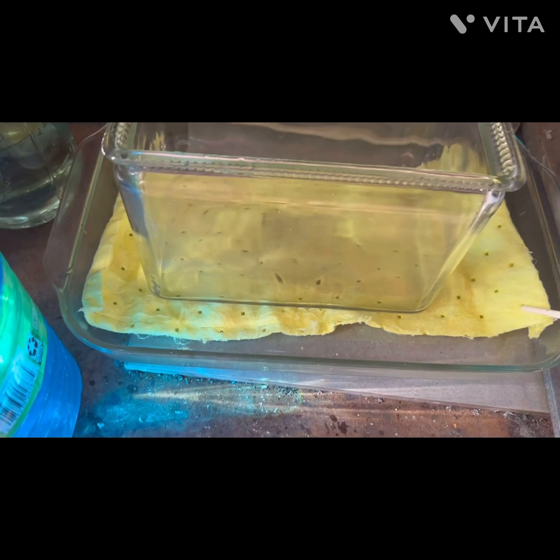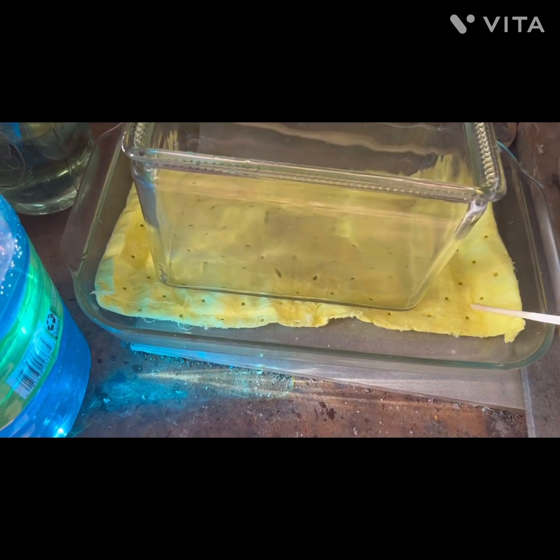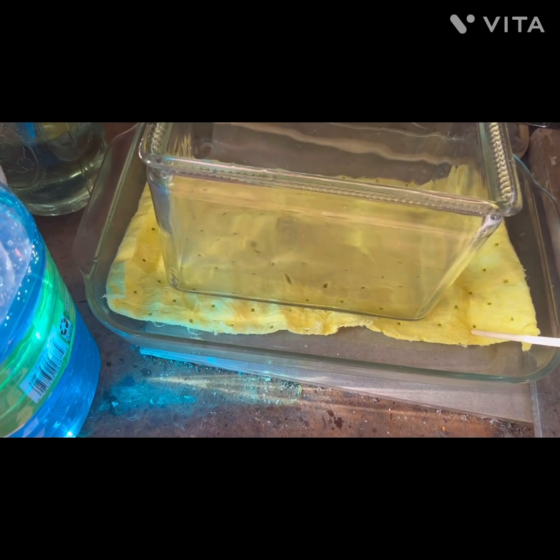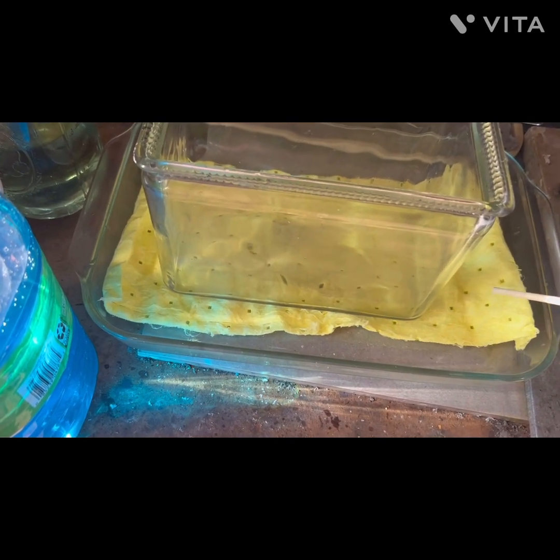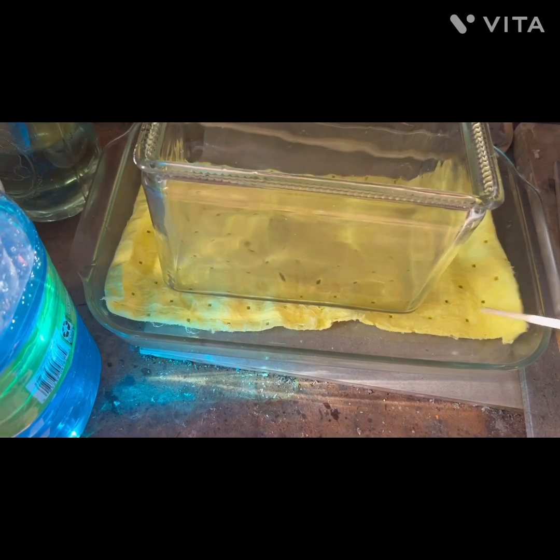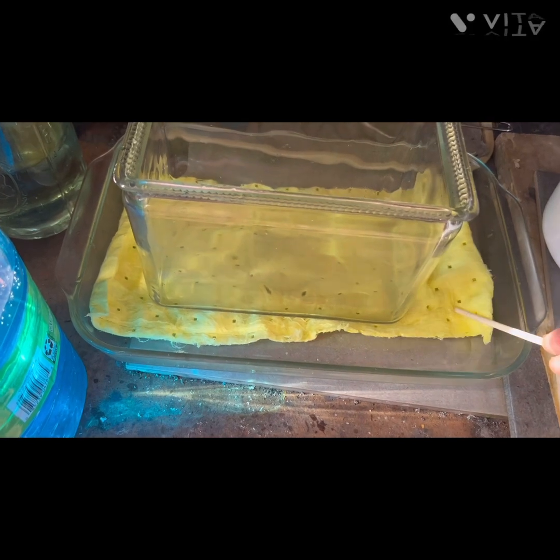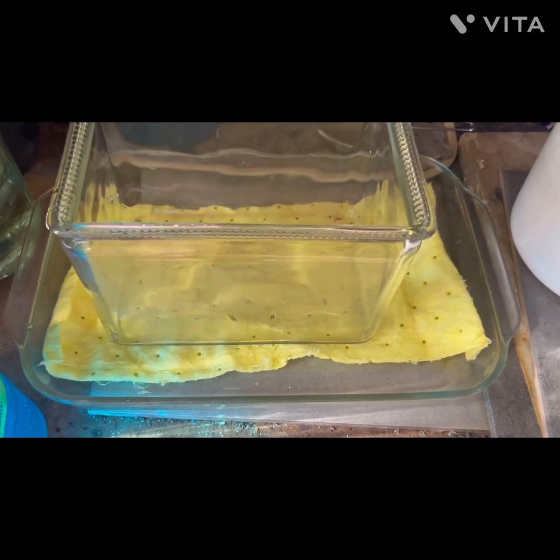I've put some absorbent material — I get this from my nitric acid bottles, it's an absorbent pad that's acid resistant. I like to use it; it came from Walmart. I'm not sure of the price per liter but I find it pretty cheap, and they deliver with no hazmat usually in two days.